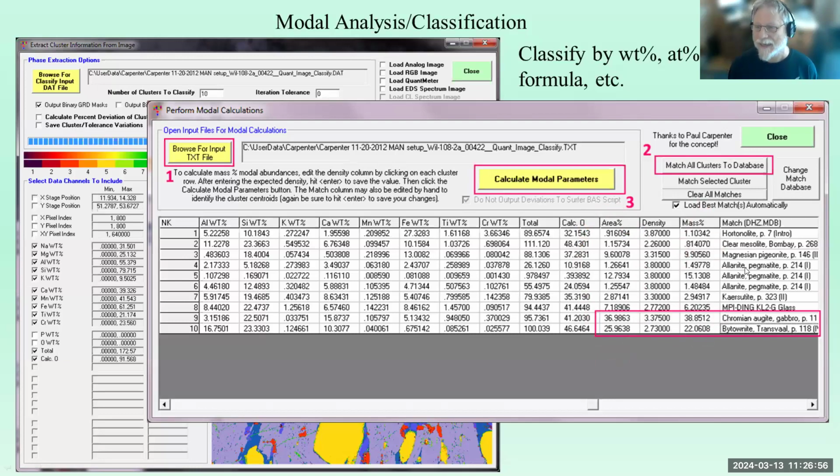And then we've also done a match ID based on a DHZ database. The software comes with not just DHZ, but also the NIST standards, the American Mineralogist Crystal Structure Dataset, which are ideal formulas for like 4,000 minerals, and Dana's ores and things like that. You can make your own databases, and you can actually define your own match database in Probe for EPMA from analyses that you perform.